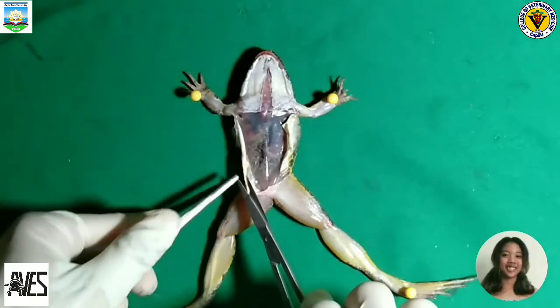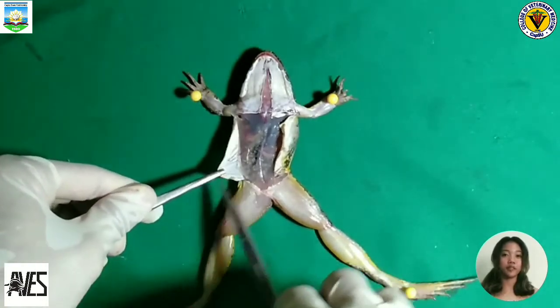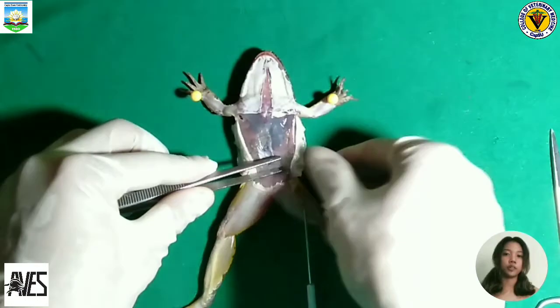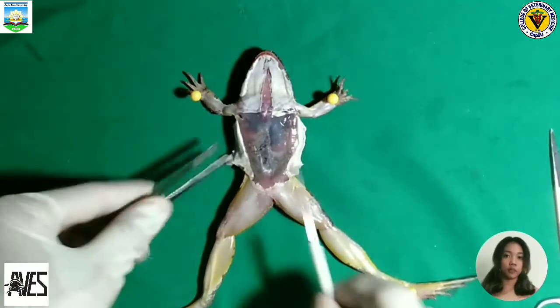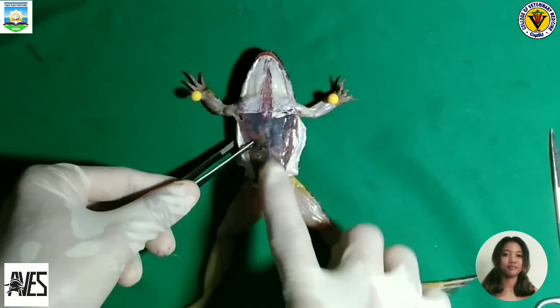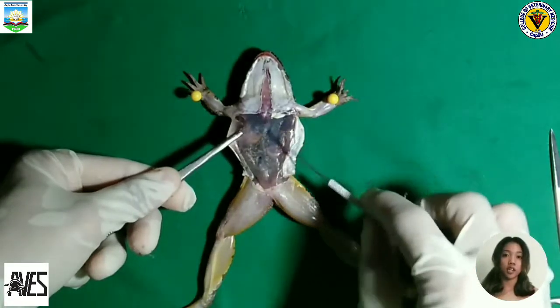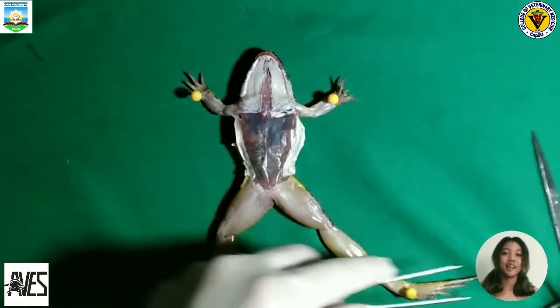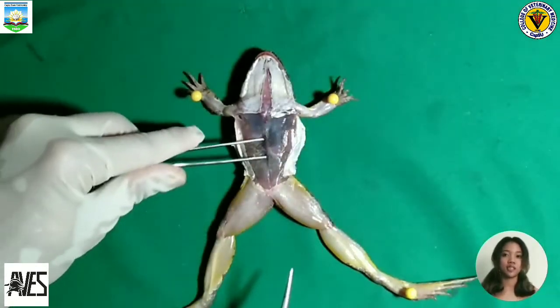After finishing the skin incision between the front and rear legs of the frog, we need to separate the skin flaps from the muscle below. To do this, pick up the flap of the skin with the forceps and use a scalpel to help separate the skin from the muscle below. Once the skin flaps have been cut, we should now pin them to the dissection tray using several pins. Now let us begin the first muscle incisions.